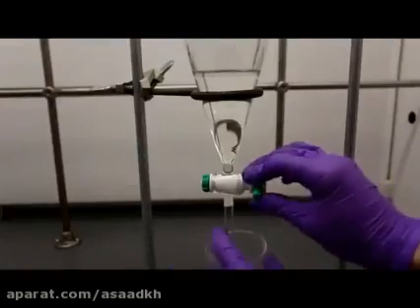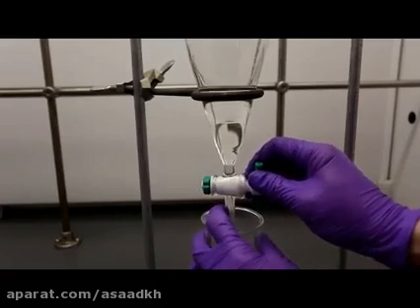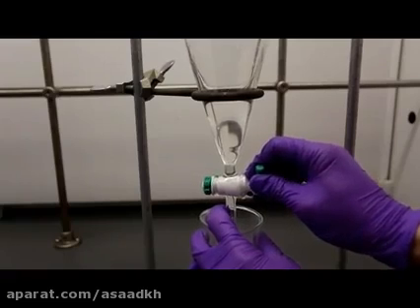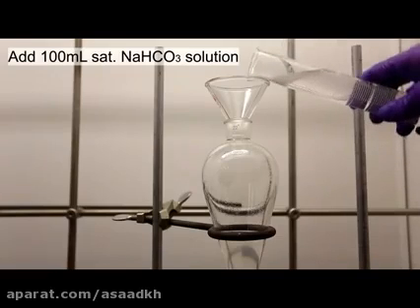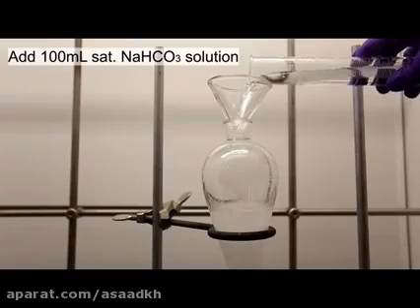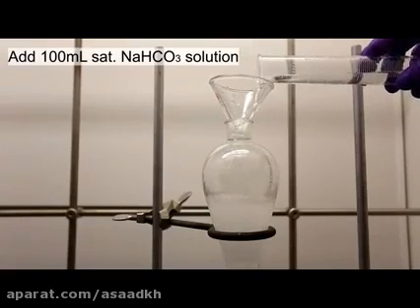The separatory funnel is then capped and shaken vigorously with frequent venting. The layers are allowed to separate, and the bottom aqueous layer is discarded and the upper pentyl acetate layer is retained. This step washes away a lot of the acetic acid and sulfuric acid. 100 milliliters of saturated sodium bicarbonate solution was added. The reaction of the remaining acids with the sodium bicarbonate is quite vigorous.